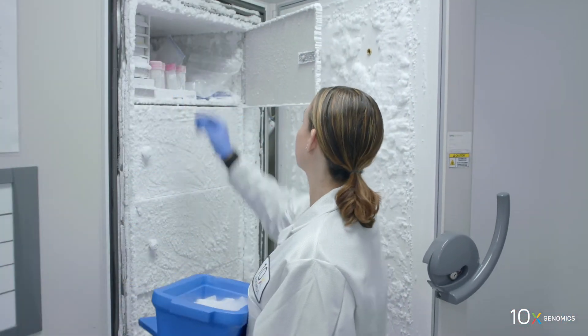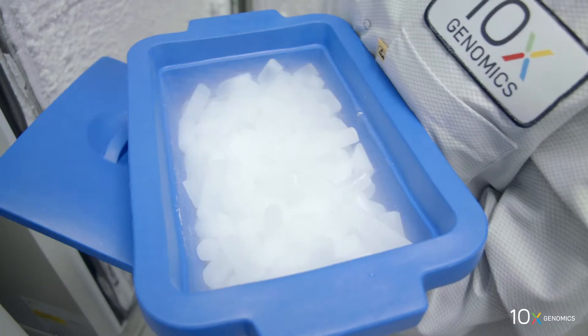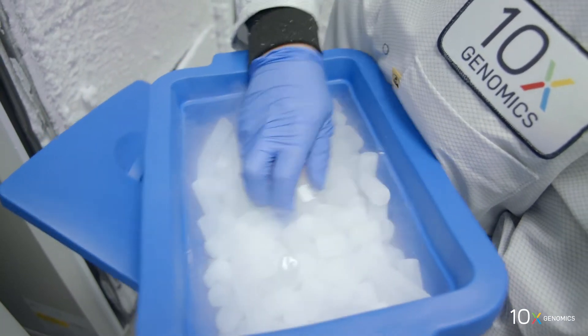Remove the tissue optimization slide with tissue sections from the minus 80 degrees Celsius freezer. Slides containing tissue should be placed on dry ice in a sealed container during transport.